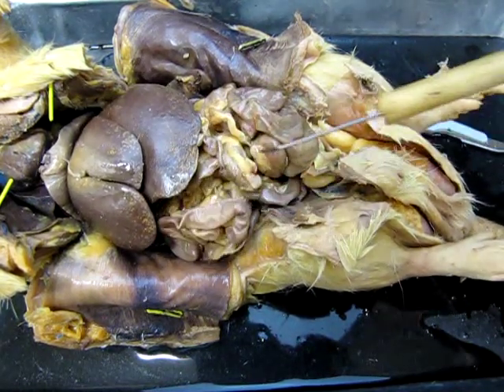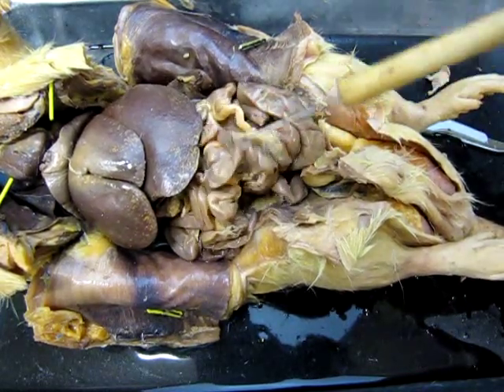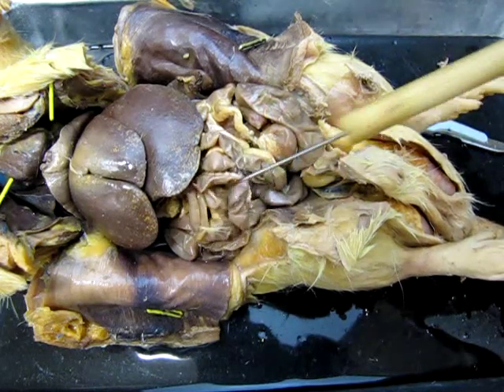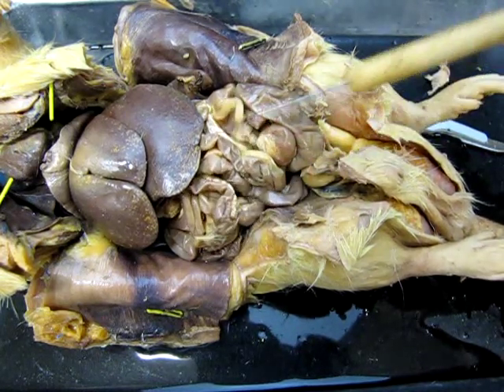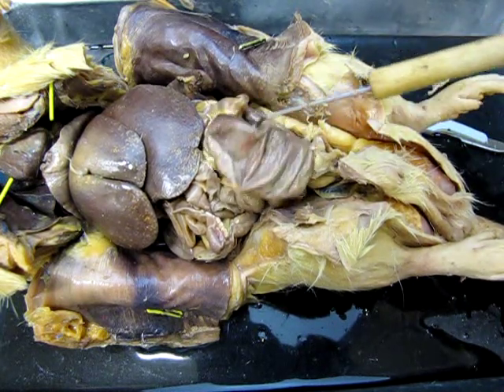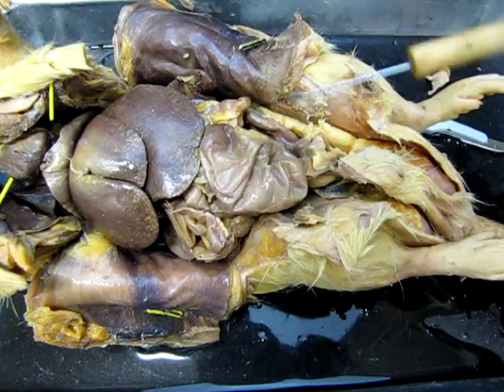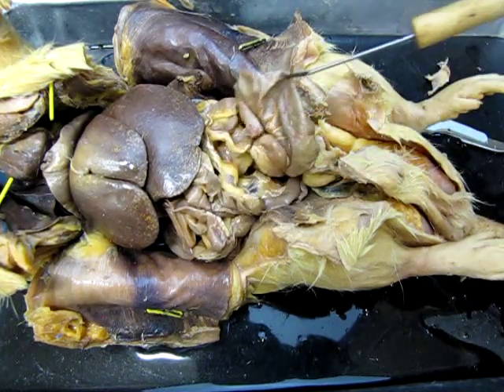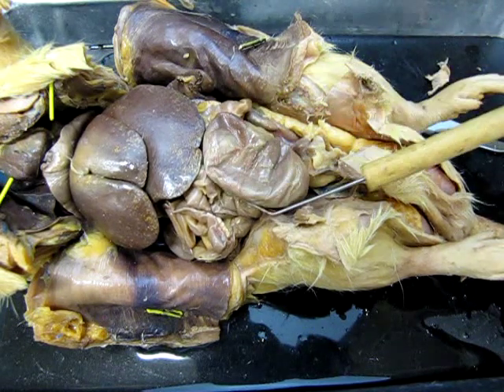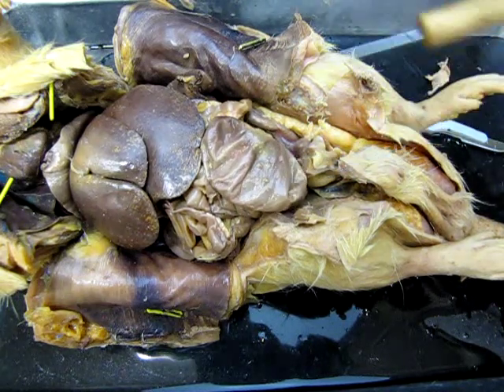Again, lots of surface area for nutrient absorption, and these are very extensively connected to all of this mesentery, which is used both for oxygen input and nutrient absorption. Now the rat has an interesting little extension of its intestine right here, this big sac. That's called the cecum, and the cecum is a bacterial storage unit. It has bacteria in there that are responsible for the breakdown of cellulose. So that's a different little structure.